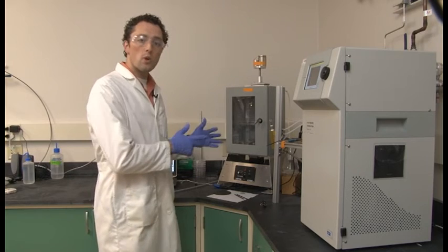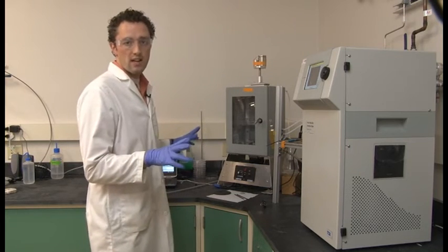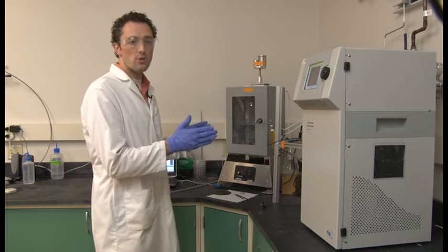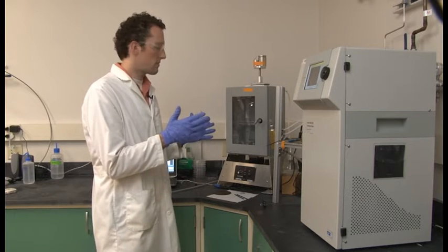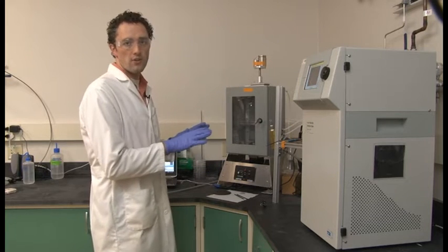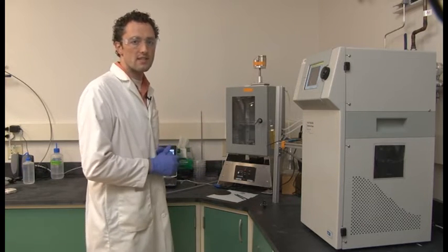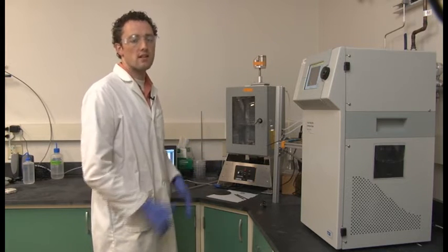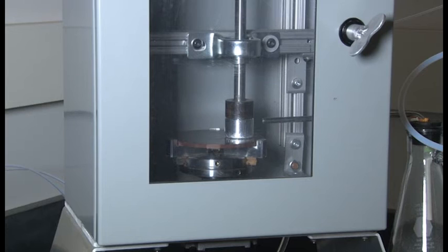Now I let the sample equilibrate for about a minute to establish a baseline on both instruments prior to starting the abrasion. Then I allow the abrasion to run for a set amount of time, in this case 4 minutes of abrasion, then turn off the abrasion and allow both instruments to come back to baseline so we can see the whole cycle of baseline, abrasion, return to baseline. Once we've established our baseline, we can go ahead and start the abrasion.